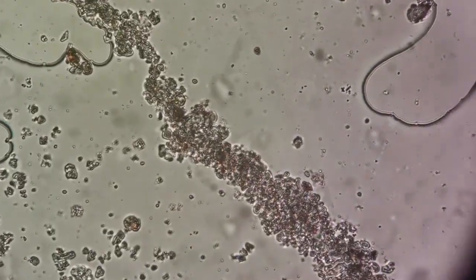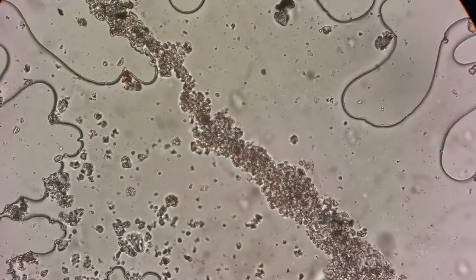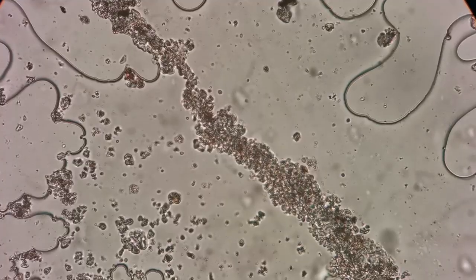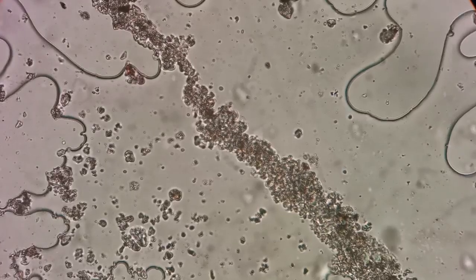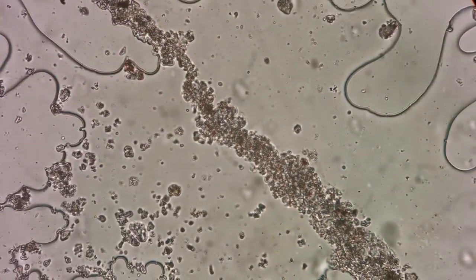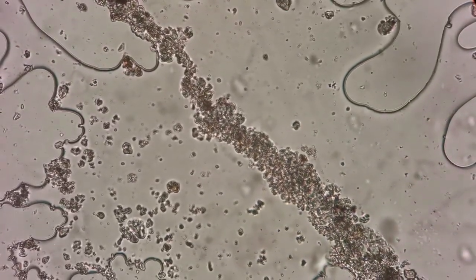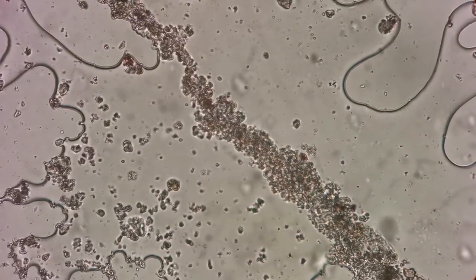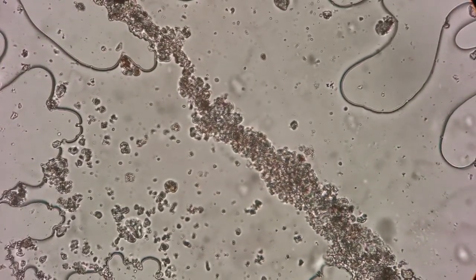The material that you see there, I've highly magnified it. Quite fine. And that makes sense. They have been transported 3,000 to 4,000 kilometers to the north. And you can see they've dried up along the line of the droplets of rain. And that's the reason they're arranged in a line. That's where the edge of the droplet was, where it dried up. So definitely this has a different source than what we had with the pollen.